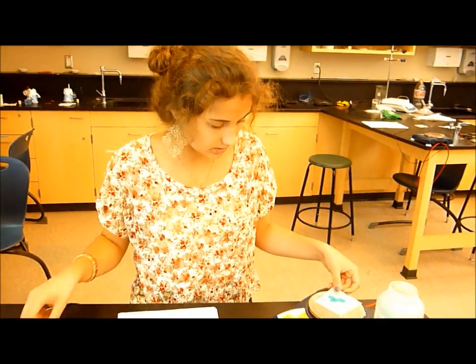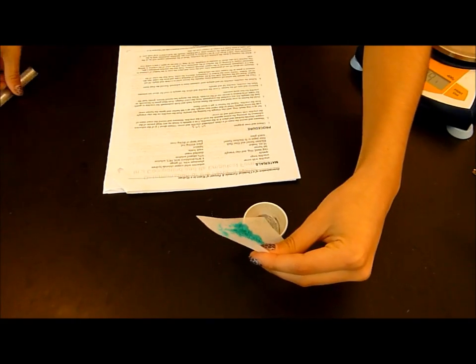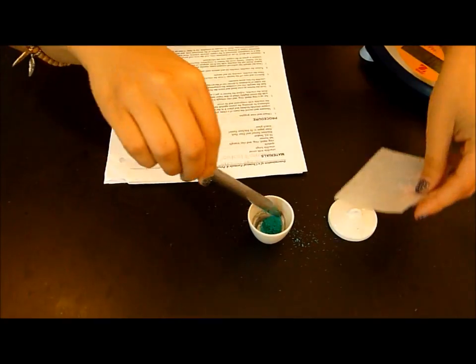Then, you're going to put it in the crucible, and make sure to break up any large pieces of the copper chloride in the crucible.